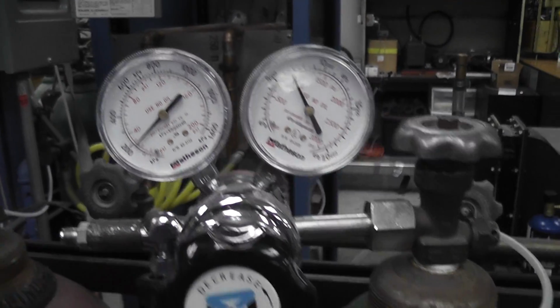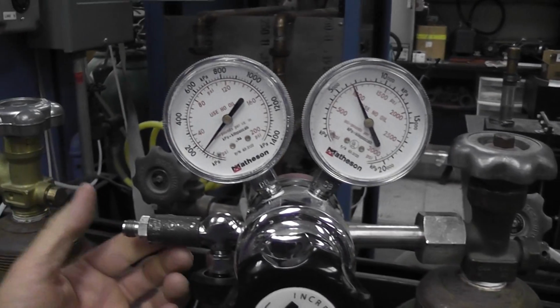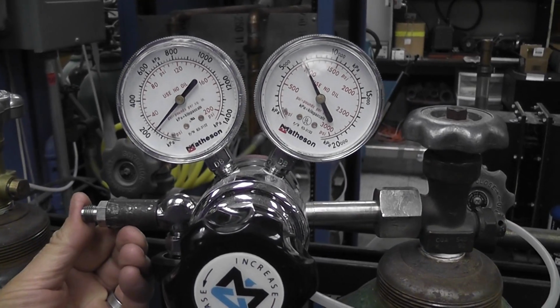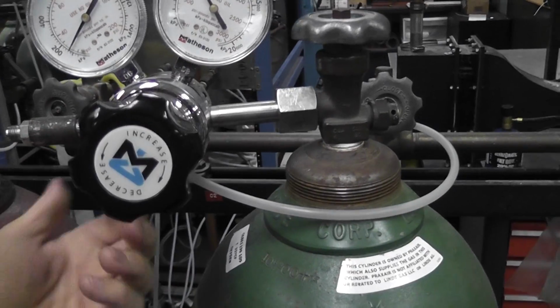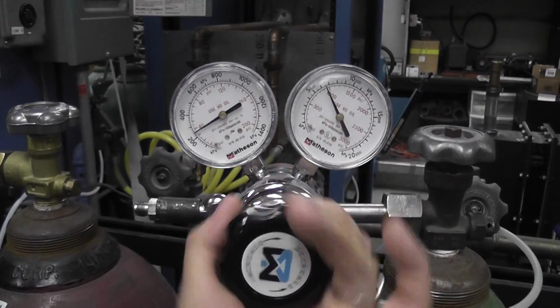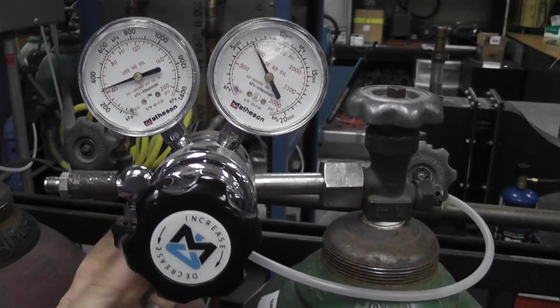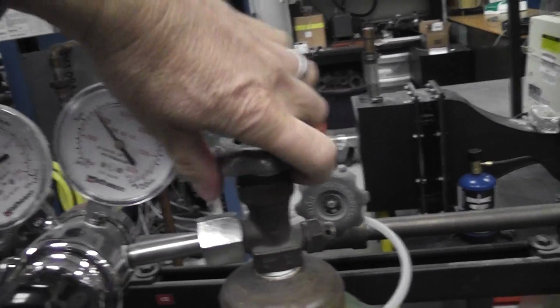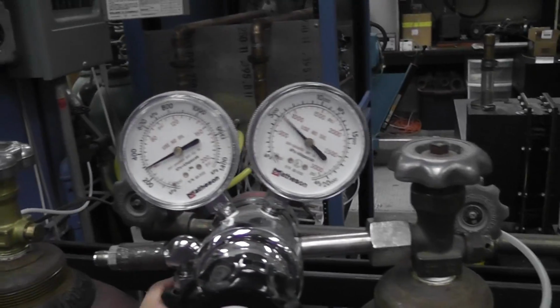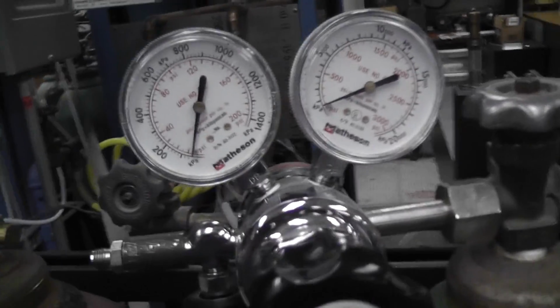Okay? We can decrease or increase that flow rate while it's flowing using this valve. All right, I think that's enough oxygen for now. I feel quite rejuvenated. All right? Good. And I'm going to turn this whole thing off and bleed it, and everything goes down to 0. Great. Okay, here is another assembly for measuring flow rates.